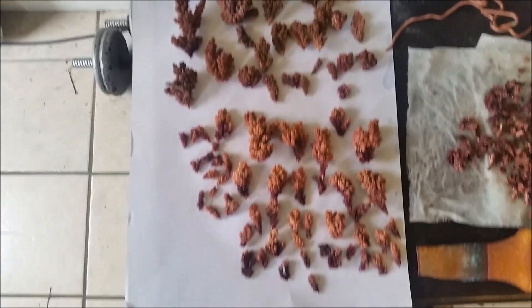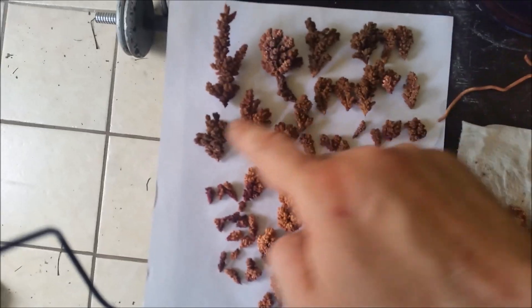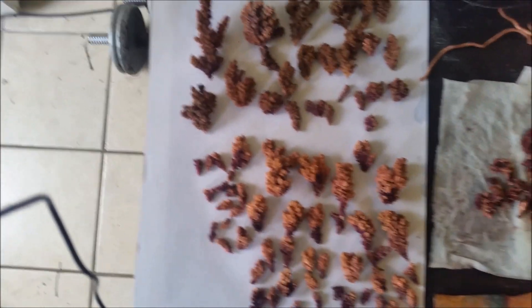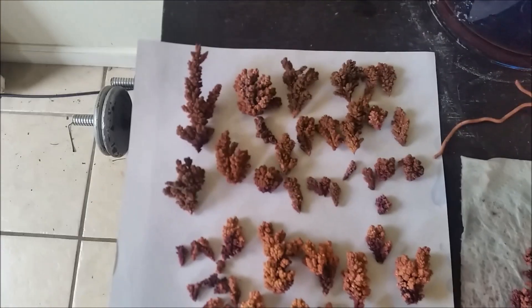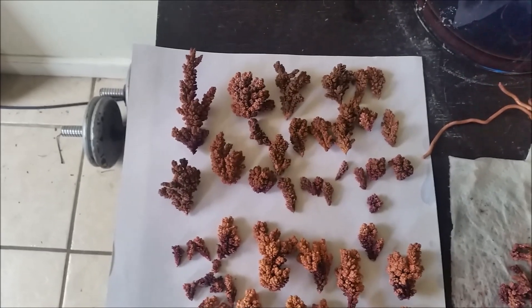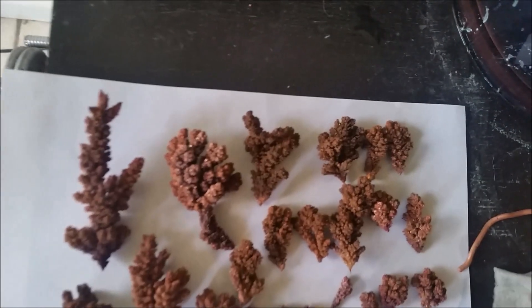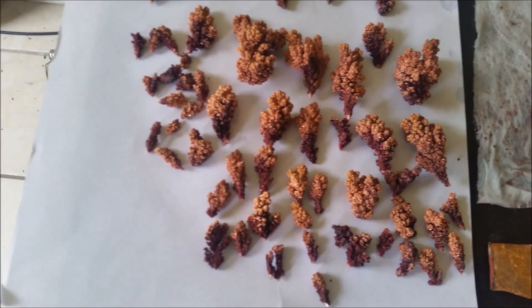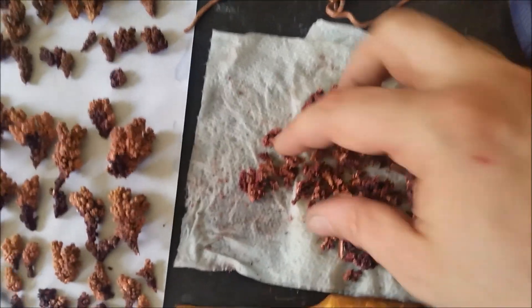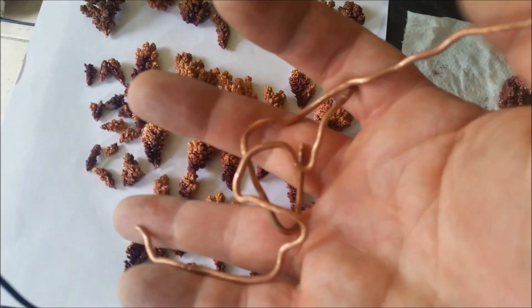Here are all the crystals I got out of this ingot so far. These crystals at the top — from here on up — are slightly darker than the ones below. These are from the first video, the first batch of crystals that I pulled. I left them out in the air without sealing them in a box or jar, and that's what happens when you leave them out. These smaller ones seem to oxidize a bit faster than the larger ones. Down here are the freshly grown ones. This is all the stuff I peeled off the cathode, and as you can see, I got most of the copper that we plated off — in fact, all of it.